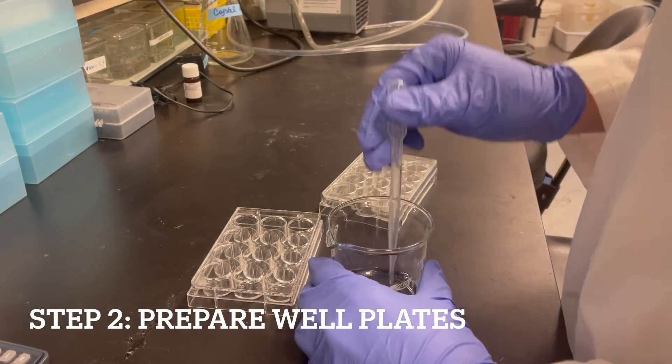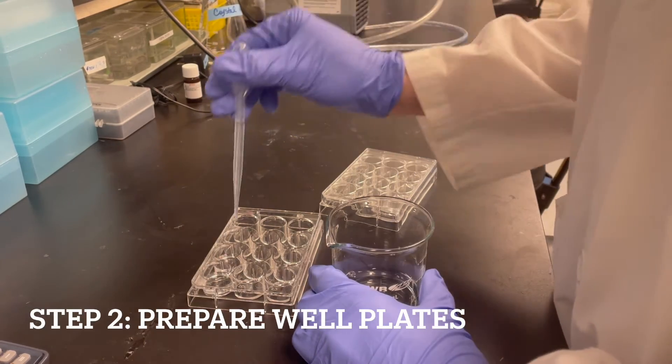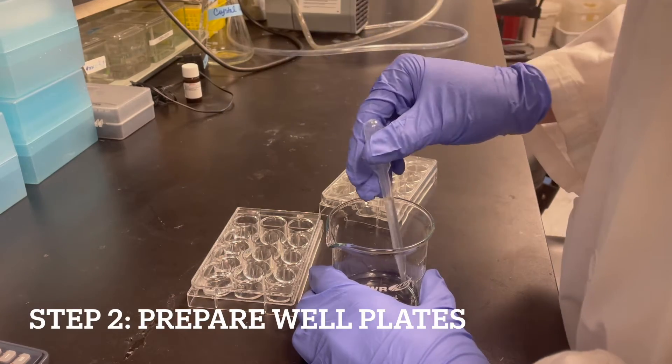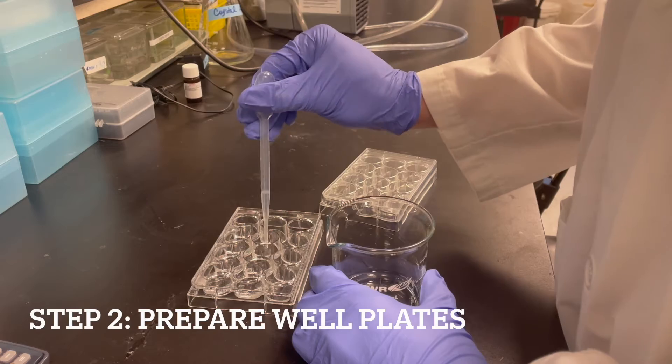Next, we are going to fill up the well plates used to hold and store the brain tissue with 0.01% sodium azide and 1xPBS. The azide helps preserve the brain tissue until they are used in downstream experiments.